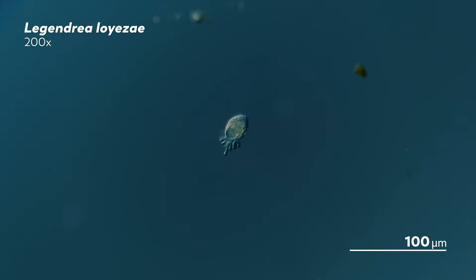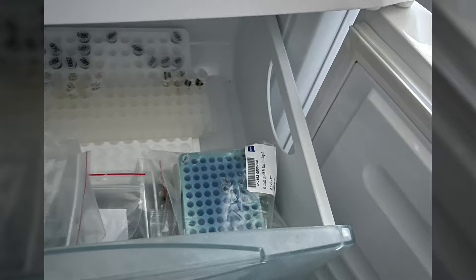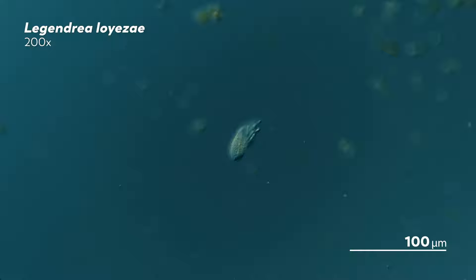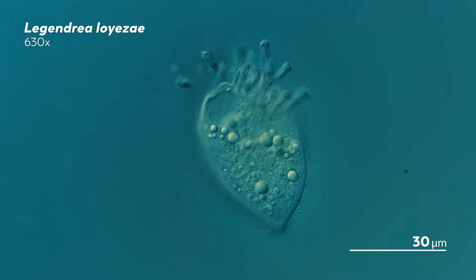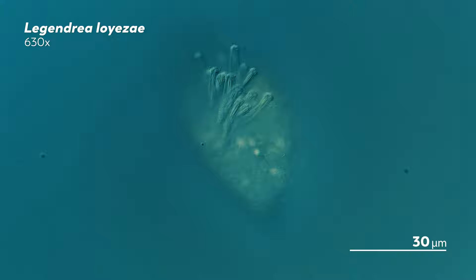The process is pretty simple. He takes the tube out of the freezer and lets it thaw out, then puts it back into the freezer and lets it ice up again. Over and over again, the organism is frozen, then thawed, frozen, then thawed. Each time that happens, the cell changes a little bit. Ice pierces through the membrane, and the insides of the cell begin to disintegrate. Buried in the cellular soup that remains is the organism's DNA.